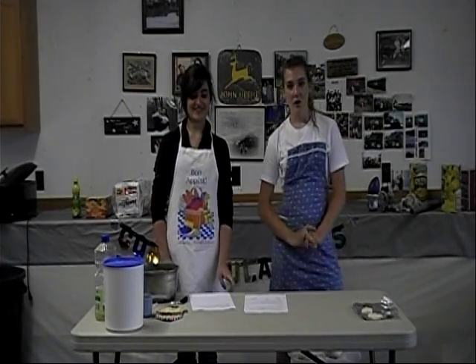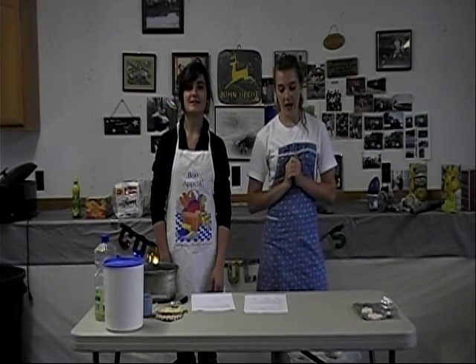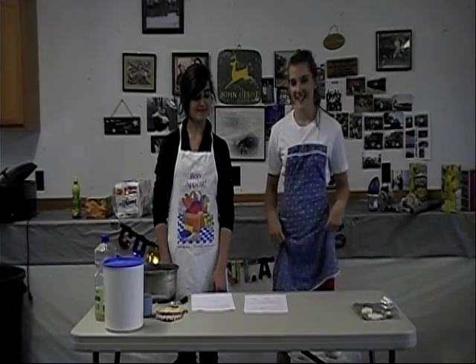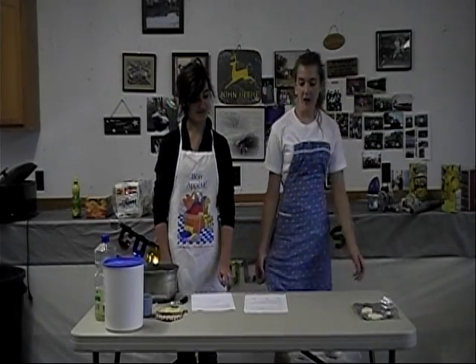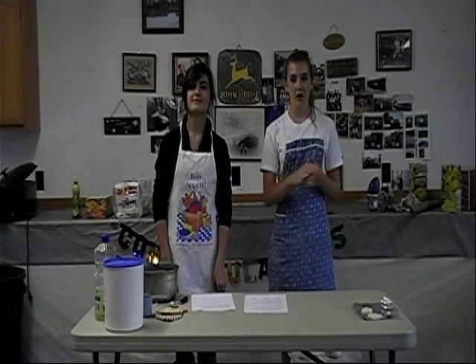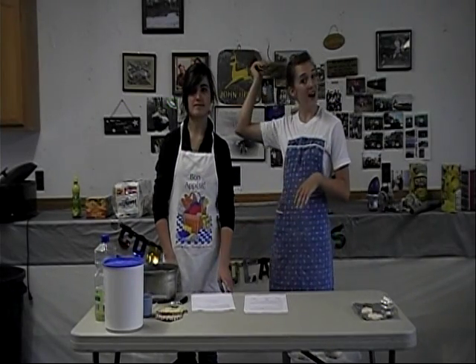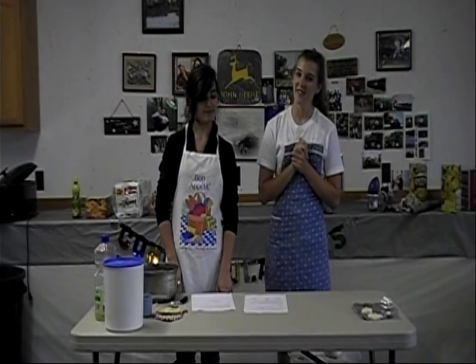For some safety tips: iodine is poisonous, so don't get it near your mouth or eyes. It may stain your clothes or skin, so wear your aprons. Wear safety goggles for the entire time you're using iodine, but you don't have to wear them while you're just making the clay. If your hair is long, make sure you put it up. And do not eat the clay, even if it looks scrumptious.